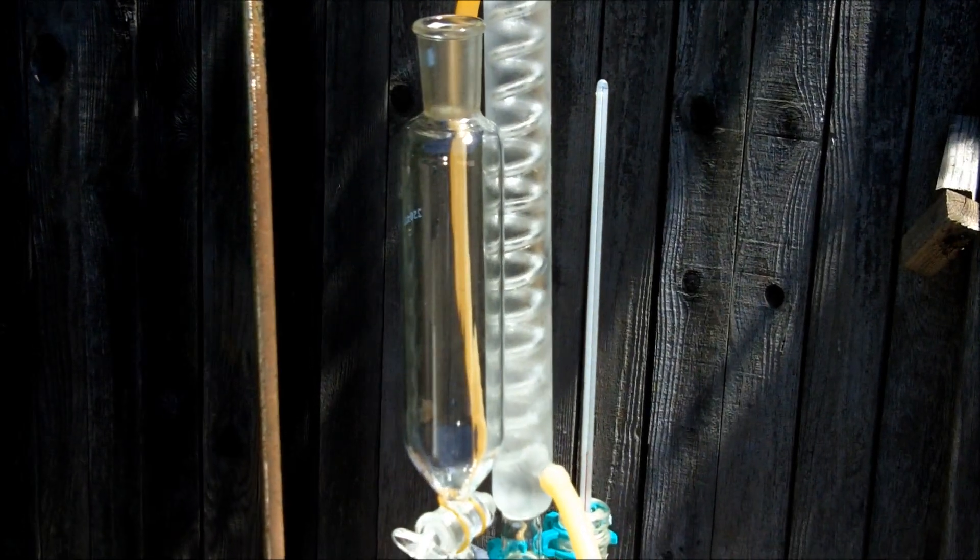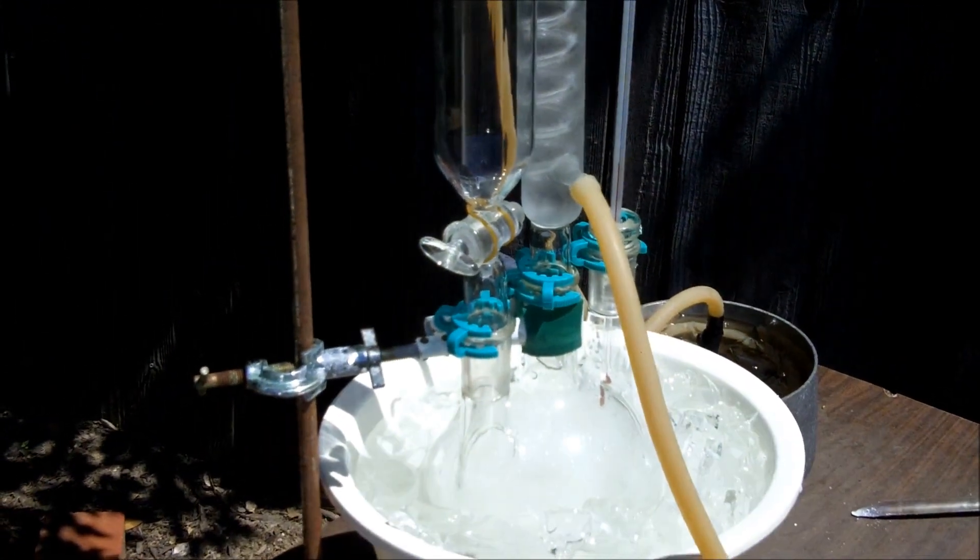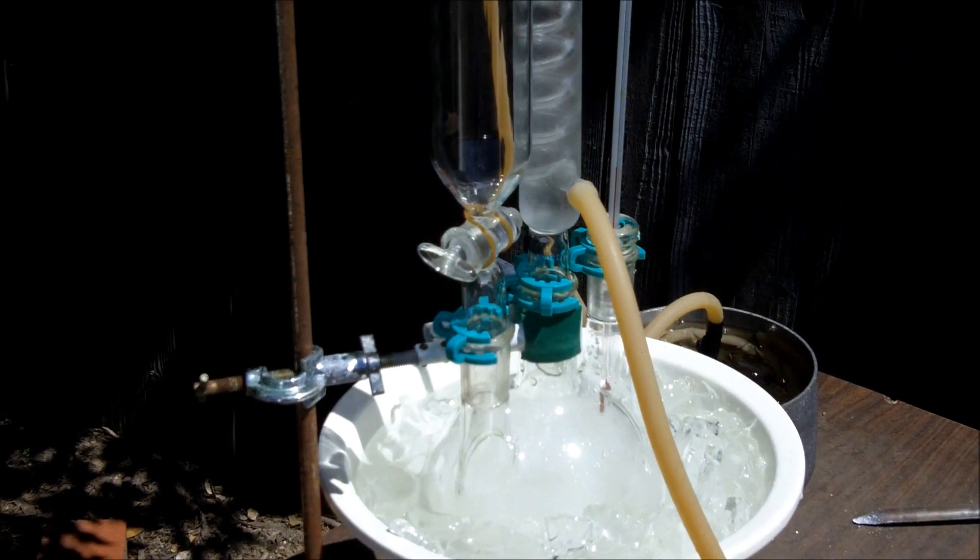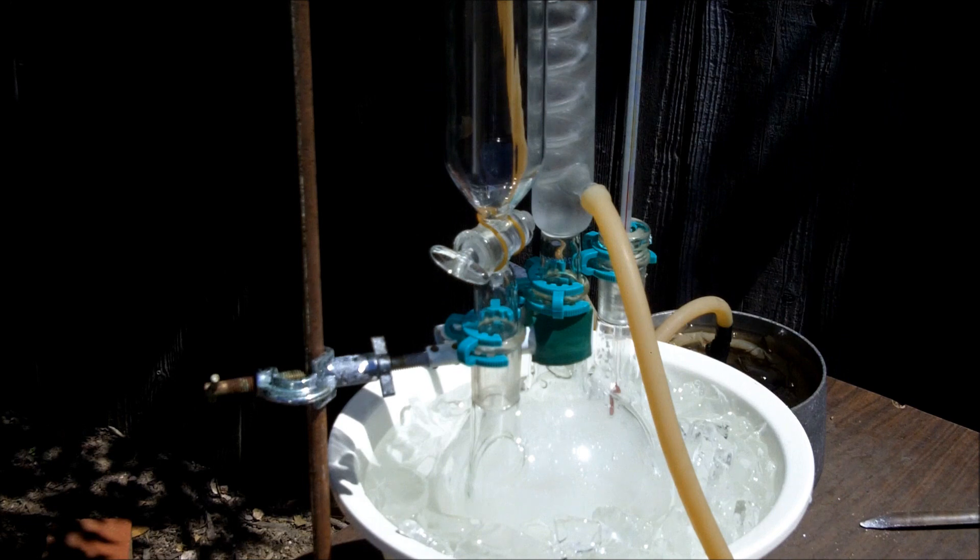However you add it, you're going to want to do it slowly because like I said, this reaction is super exothermic and it's been known to run away. If you add too much acetone too fast, it's gonna run away - it could start blowing pieces of glass off, so that's not good.